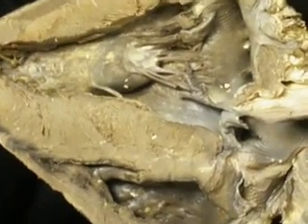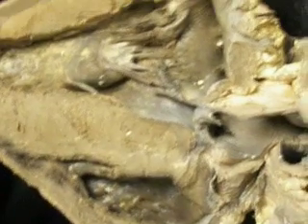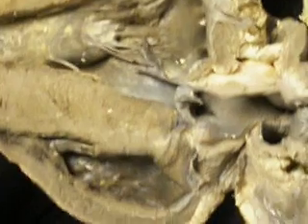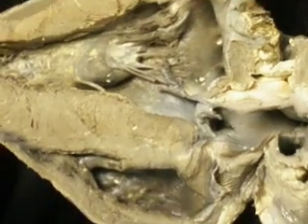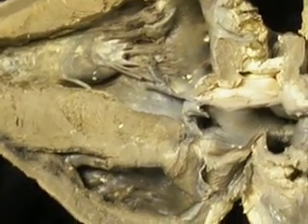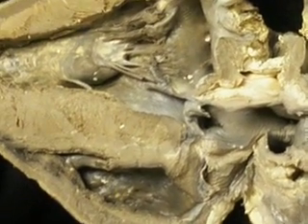The coronary sinus, though, when it drains, it drains the coronary artery, which we have a left and a right of, right? Coronary sinus is a vein. You're thinking of the artery coming out, splitting off of the aorta. Right. That she was talking about in class today. The aorta splits into the right and left coronary arteries. Then it drains into the sinus. I'm trying to make it the same thing. Okay. Yeah. This is the coronary artery here.